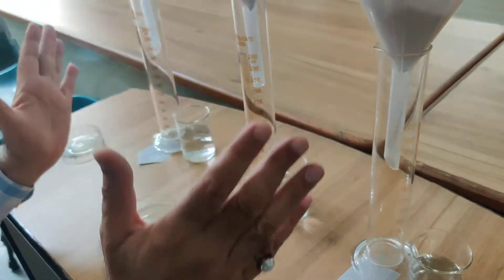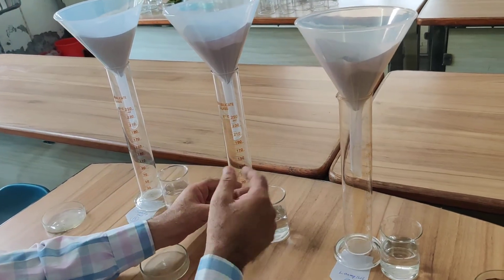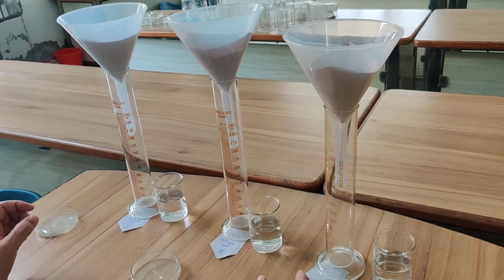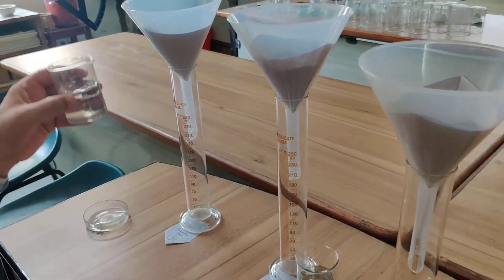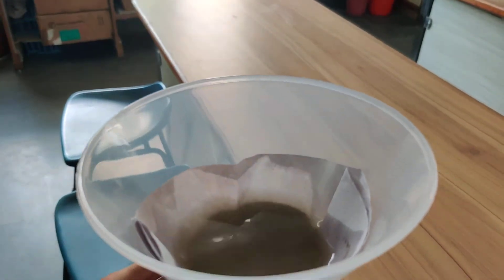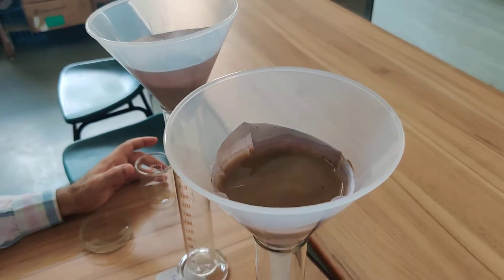In these three funnels we have to add 100 ml of water simultaneously. These are measuring cylinders so you can see the measurement given here. We have to put the water together immediately — 100 ml water going into the sandy soil sample, 100 ml water going to the clay sample, and 100 ml water going to the loamy soil sample.